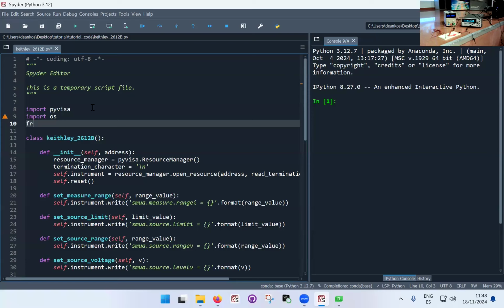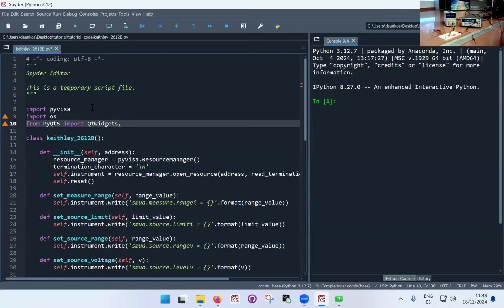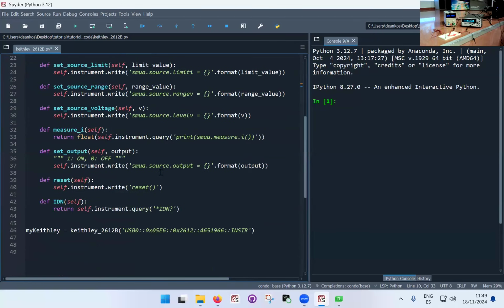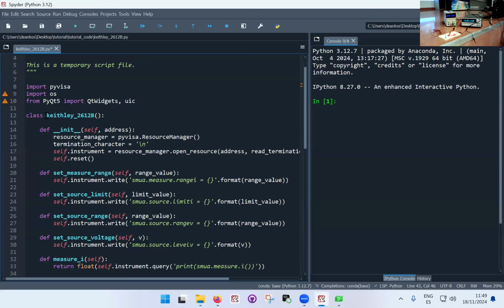And then here I'm going to import a few packages from PyQt5, import Qt widgets. So I'm just going to import a bunch of things. You need to know what to import. This is what you need to import. I'll tell you that now. So once I import this, I'm going to create a new class for the Keithley interface. The previous class was for the Keithley instrument. Now I'm going to create a class for the Keithley user interface.